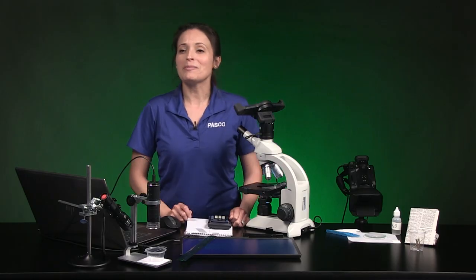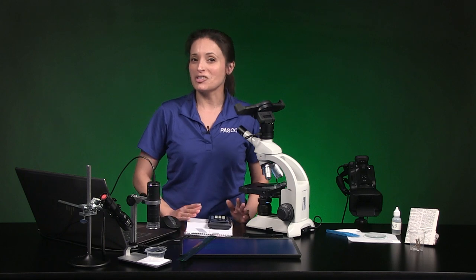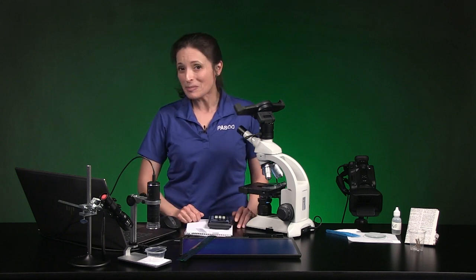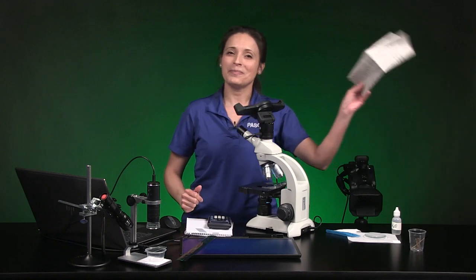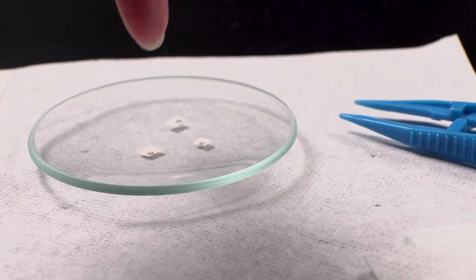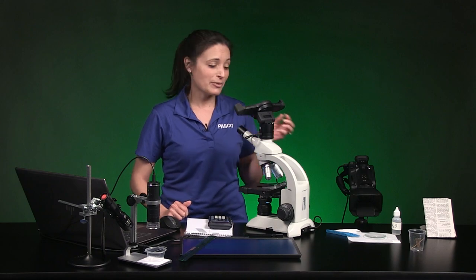This part is all about the dry mount slide preparation technique. The dry mount technique is used to prepare specimens that lack moisture, such as dust particles, pollen, insect parts, flower petals, feathers, and hair. Today our specimen is a single letter E from a newspaper. I found some E's where there was nothing printed on the back and cut them out so only the letter E is there. You might find it easier to handle the E's with forceps, tweezers, or toothpicks, so I have some tools ready.